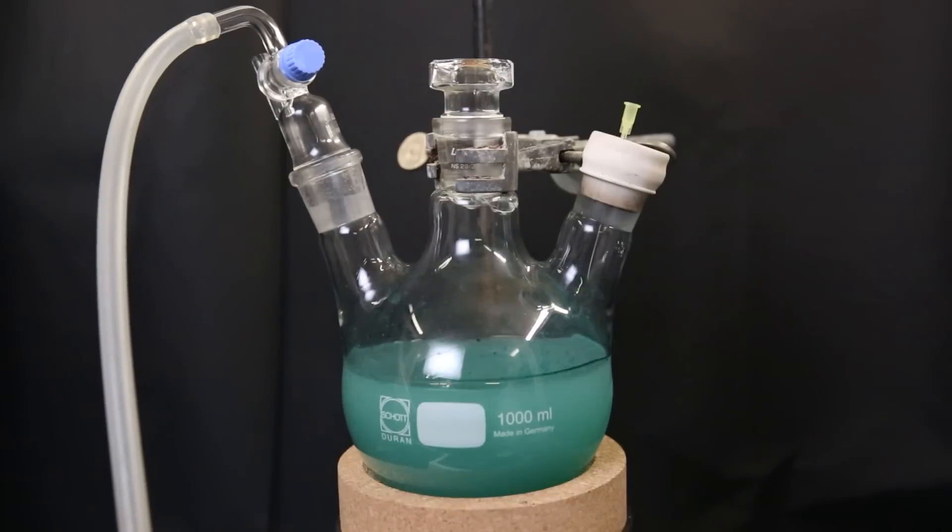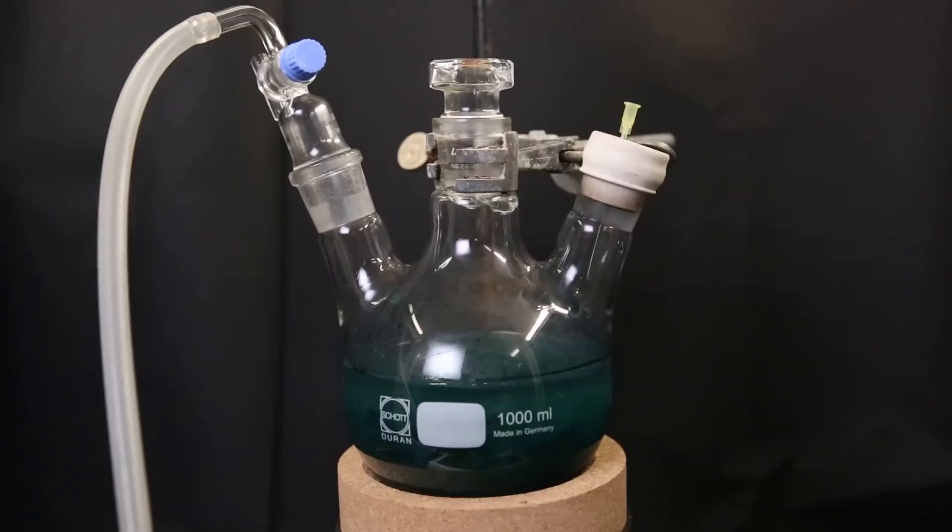When everything had been added, I leave it to stir at room temperature for 1.5 hours. As the reaction progresses, it turns to a very dark green.